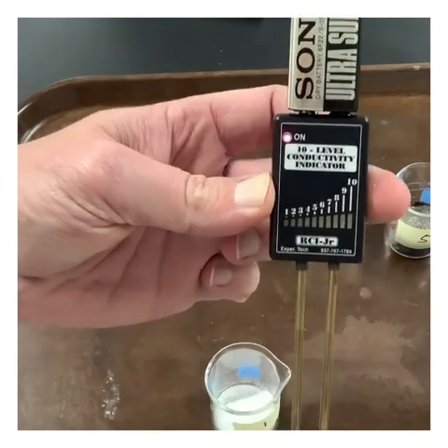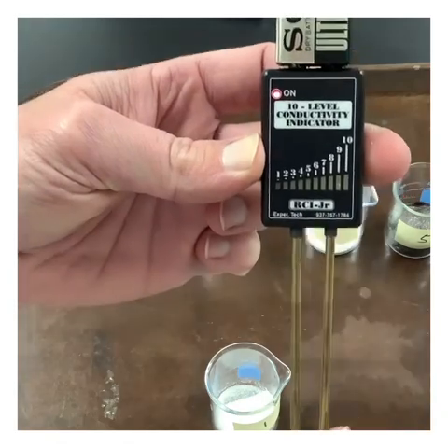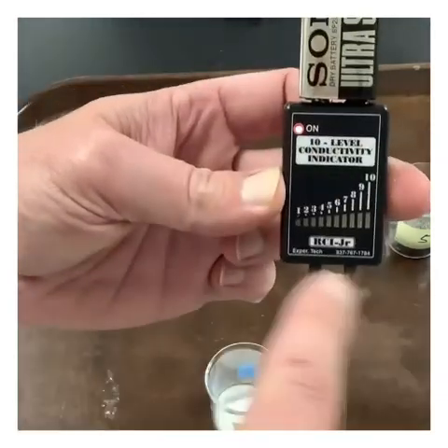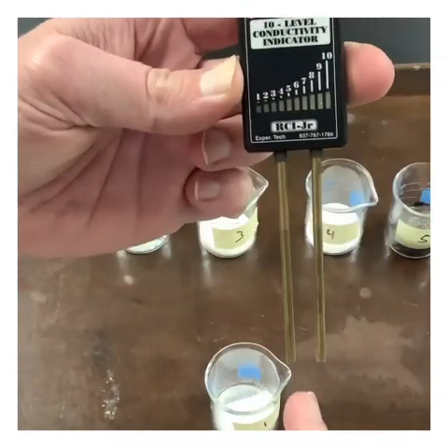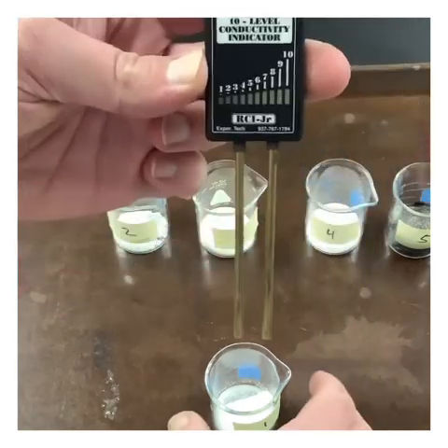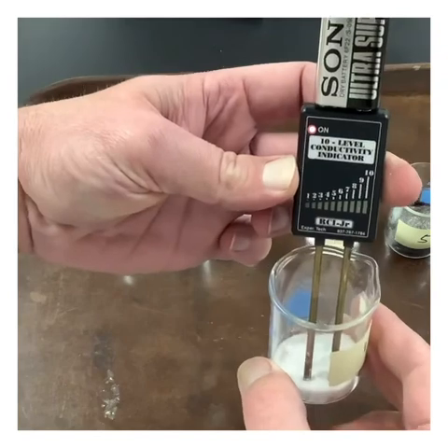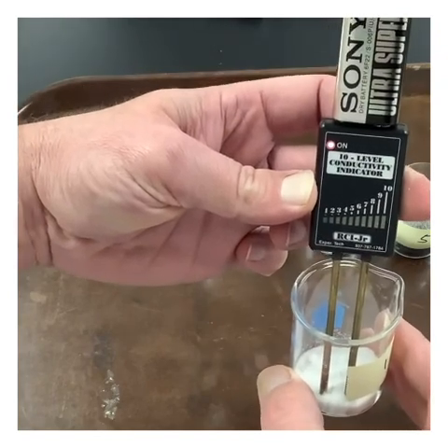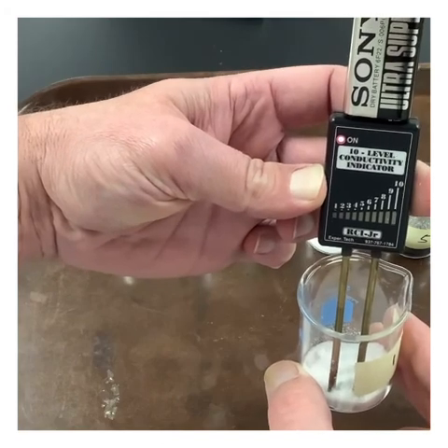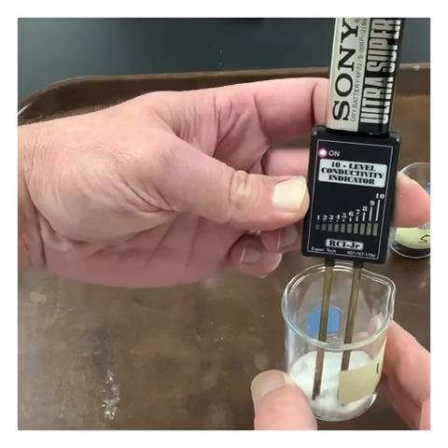You'll notice that there are no red lights coming on here. Nothing is conducting, because what we're testing right now is the air. We have electricity going down one pole, and when it can go back up into the other one, it completes the circuit and we get a light that comes on. But the electricity can't jump through air, so air is not conducting. When I submerge it into this substance here, it's not able to travel through the substance as a solid. So we would say that this one is not conducting electricity as a solid. This would be a no.